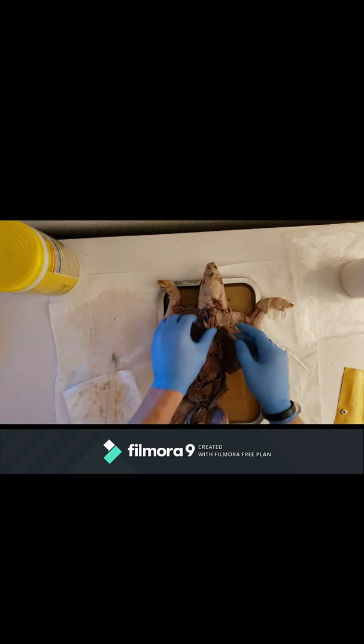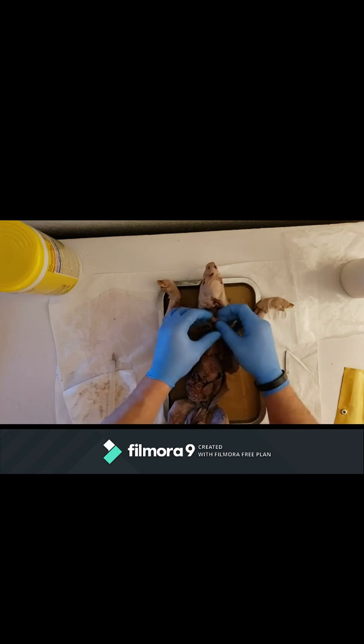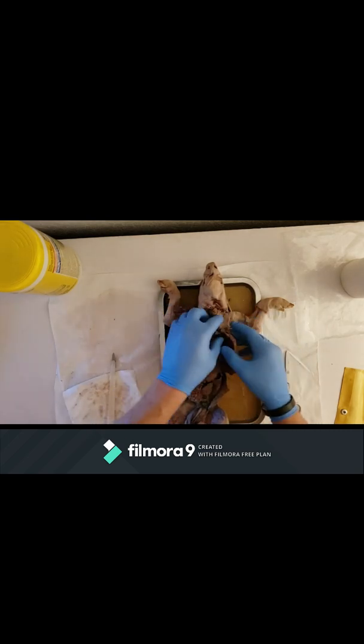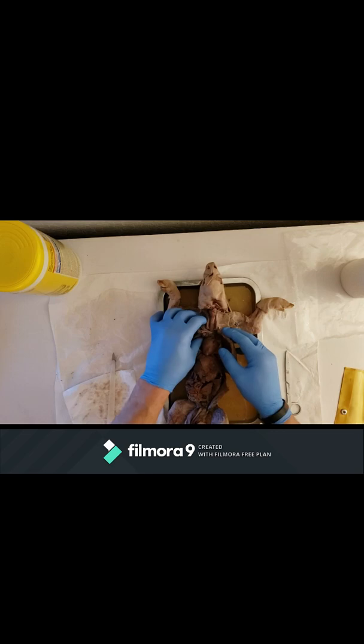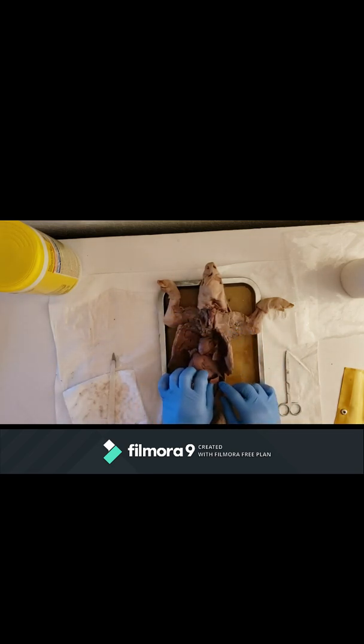So the thymus, like I said, is cut away, but it's generally here. You have your thyroid, and your thymus actually goes around that and encompasses it, but it's cut away because I did the complete dissection before I made the videos. And the spleen is this flap-looking organ right here.